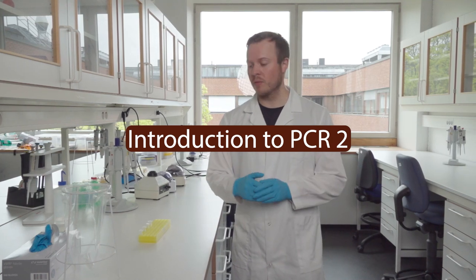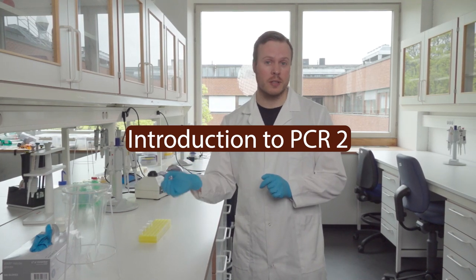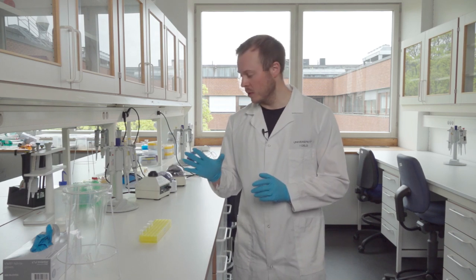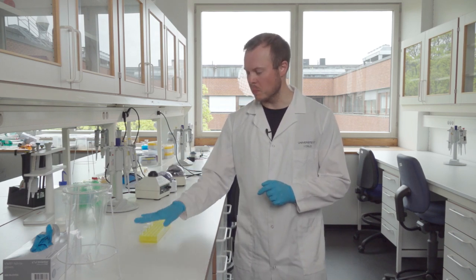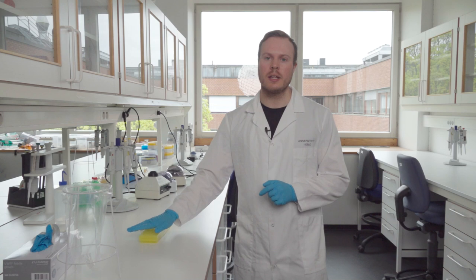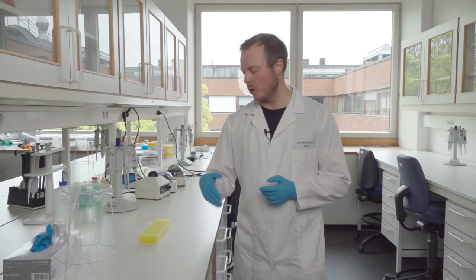Now we have done the first cleaning step of the PCR products. We have all these Eppendorf tubes with clean DNA that we've hopefully gotten rid of dimers.